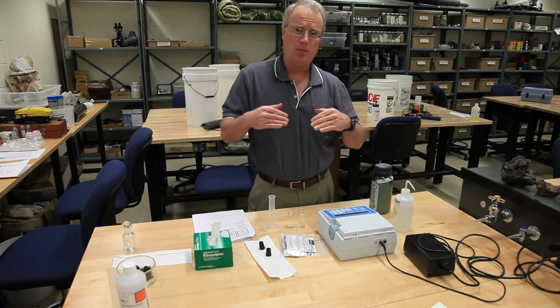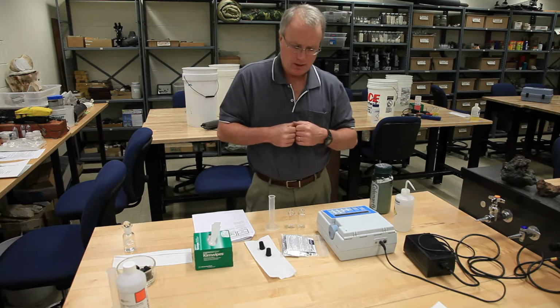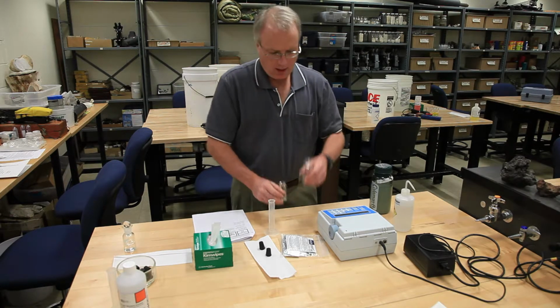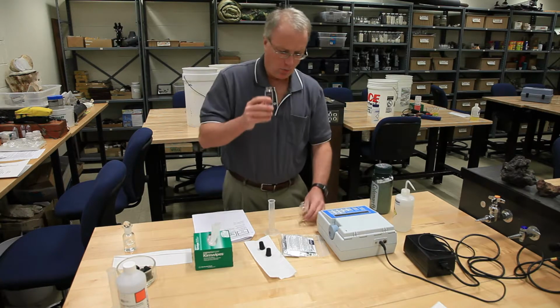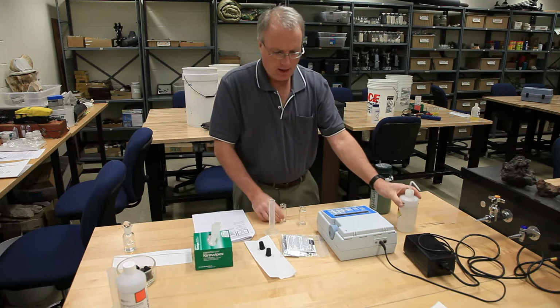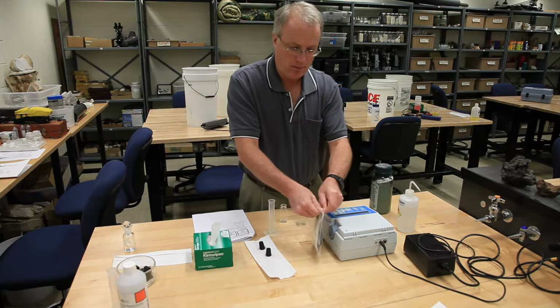You would start at a number below 400 and spin the dial until you got up to 400 and then stopped. For this particular test, it asks you to fill one of your cuvettes with sample water and one of your cuvettes with deionized water, and then both of them are going to get a powder pillow.